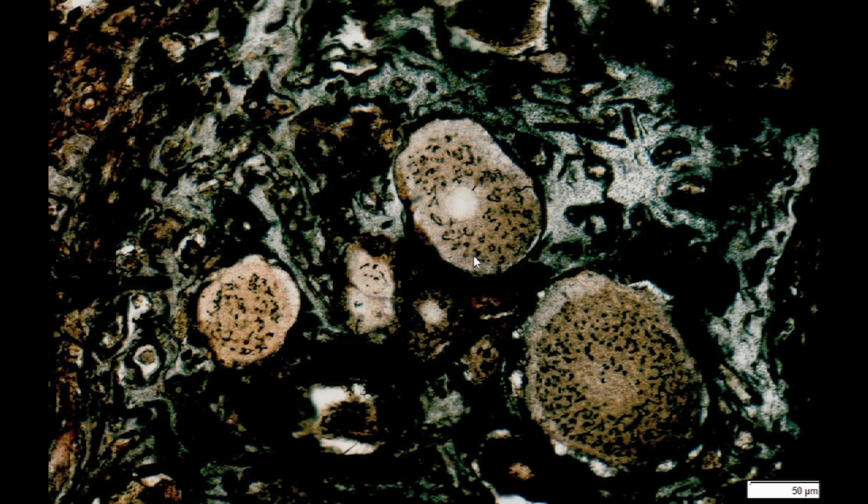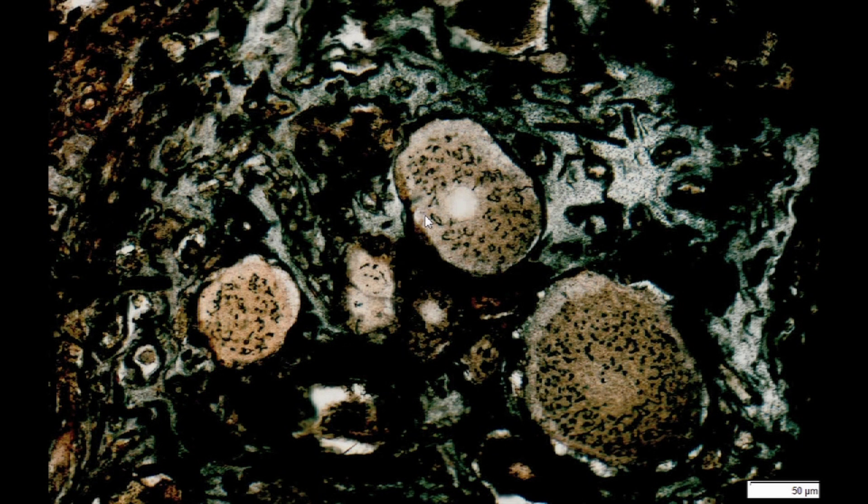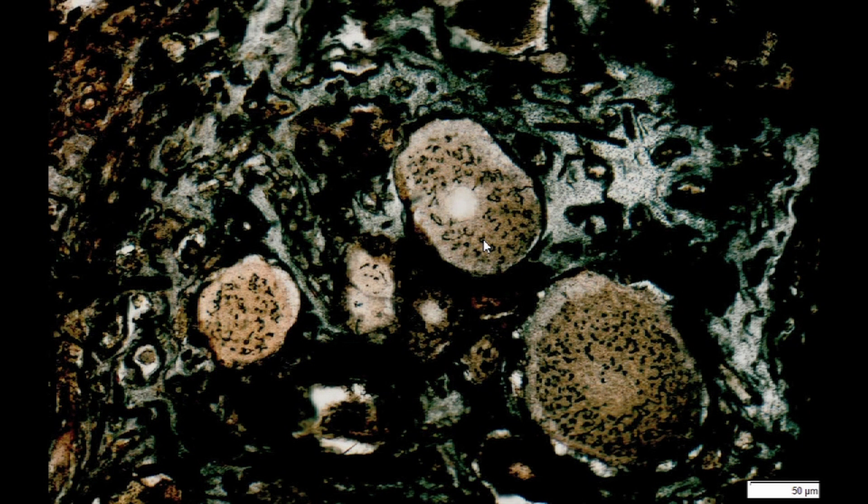This controversy was finally resolved with the use of electron microscopy in 1950. Within neuronal pericaryons we can see the Golgi apparatus stained with a modified staining method used by the discoverer of the described structure. The silver reaction yields dark coloured thread-like elements distributed in the cytoplasm which form the Golgi apparatus.